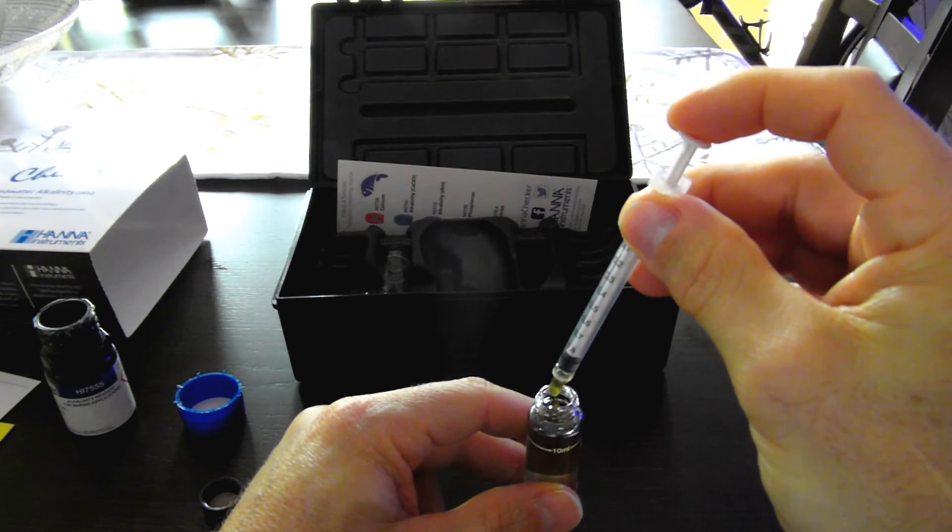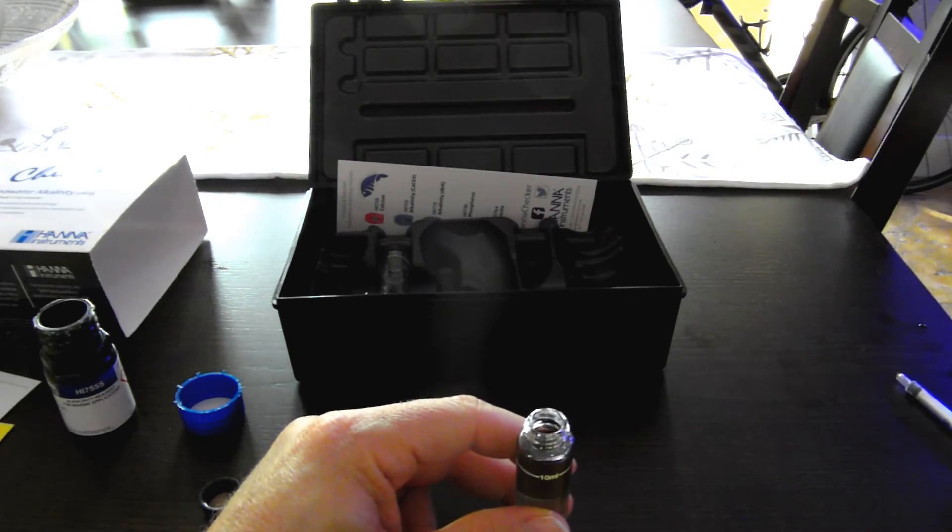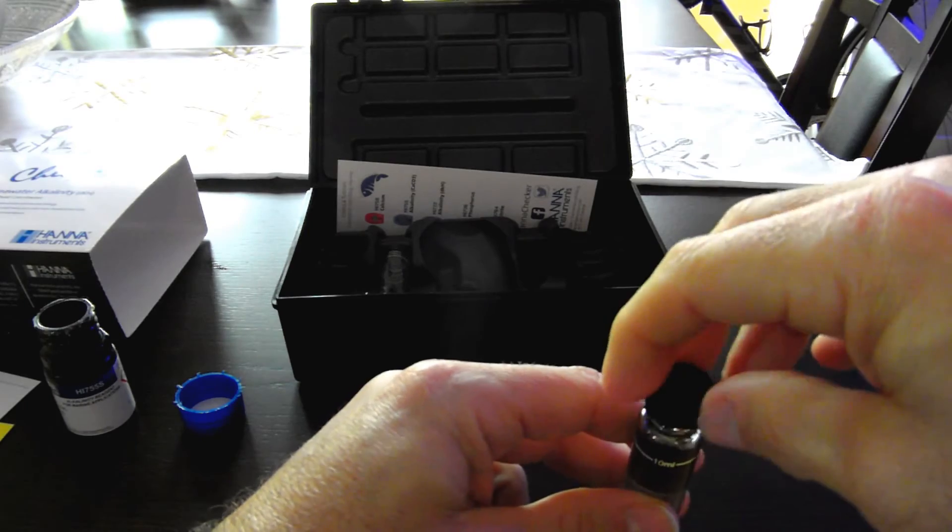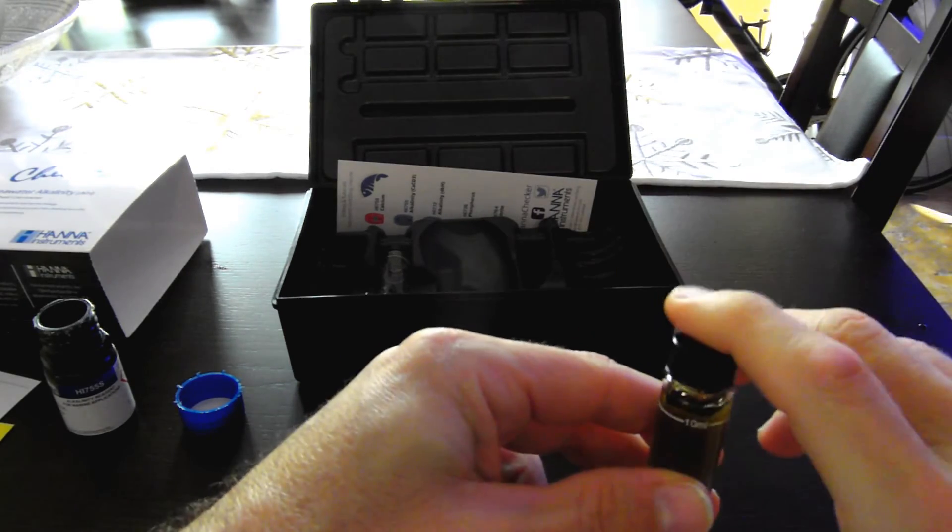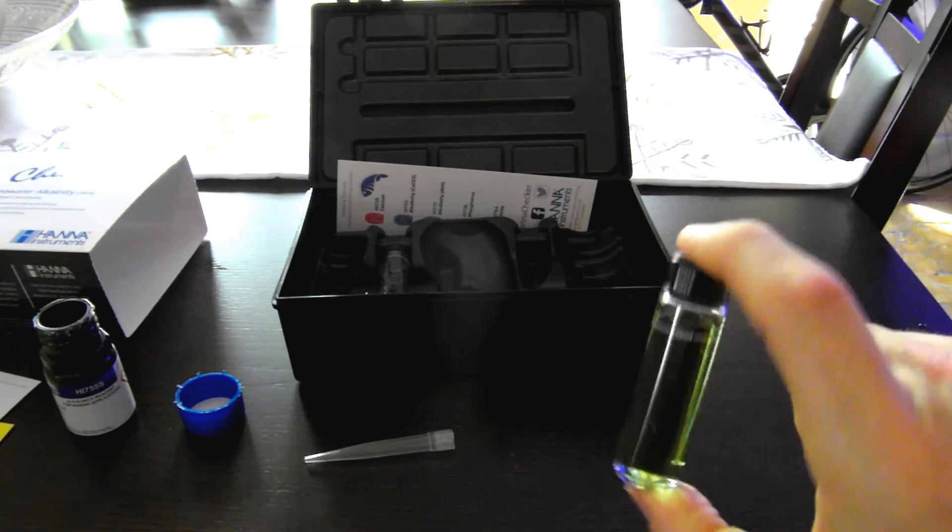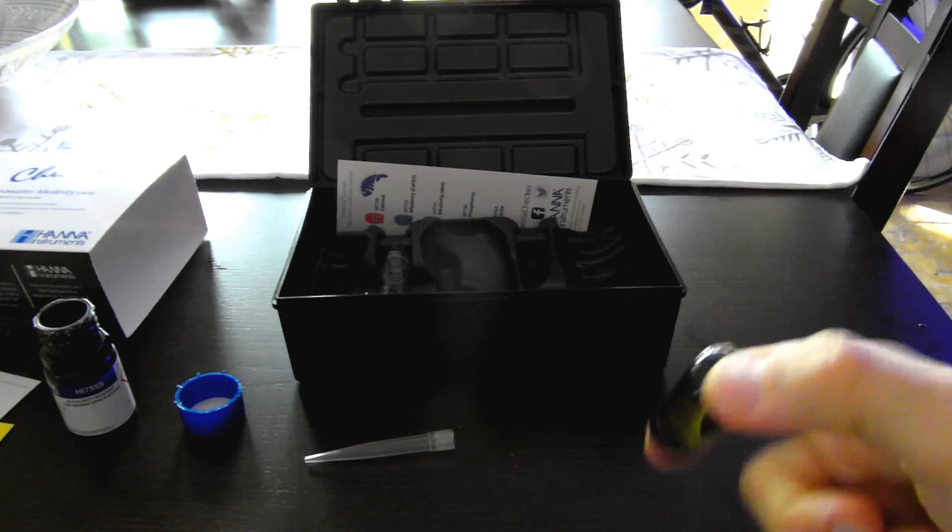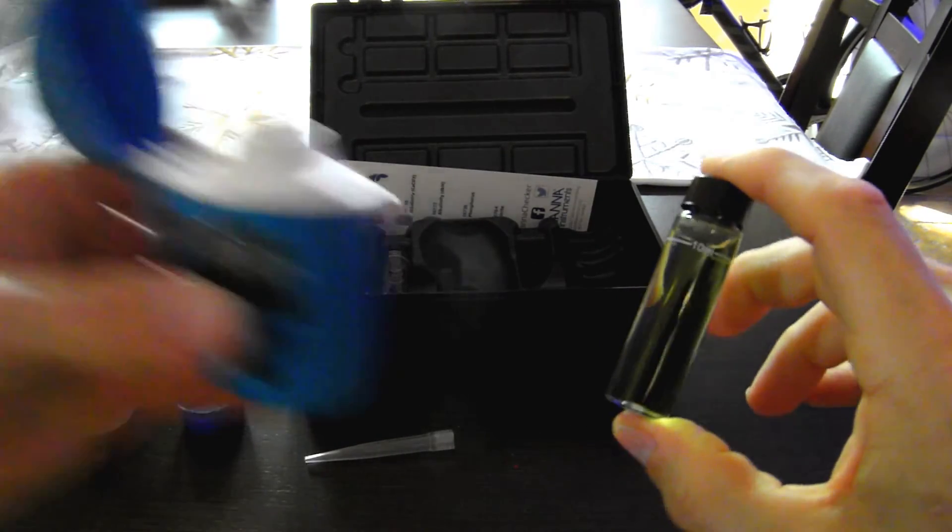Good to the last drop. Then we're going to recap the sample and invert it several times. Ensure a thorough mix and place it back into the alkalinity checker.